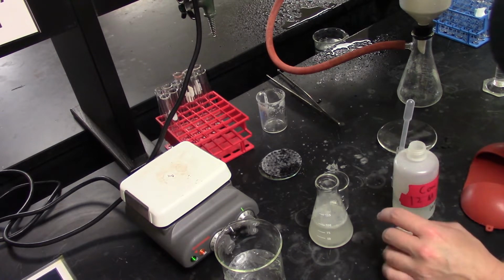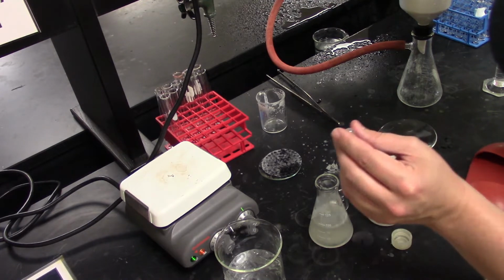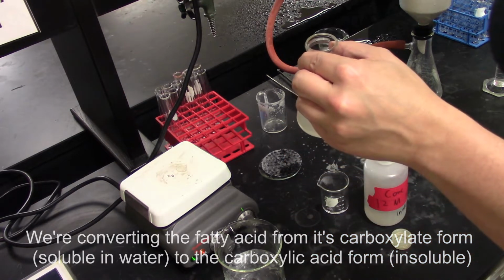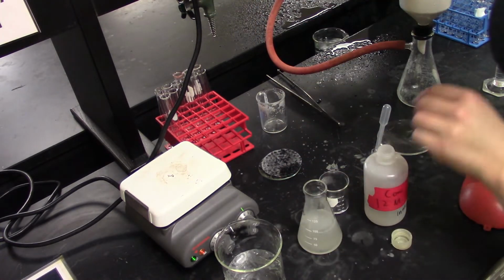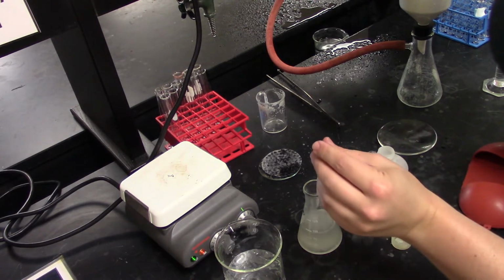What we're doing by acidifying is we're taking the fatty acids and converting them from carboxylate ion form back to their organic form, so the actual carboxylic acid. So what's going to happen as I start doing this is it's going to start getting more and more chunky in there. It's going to start seeing the organic start crashing out.